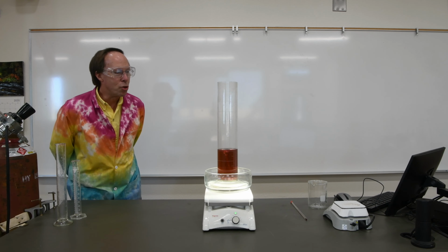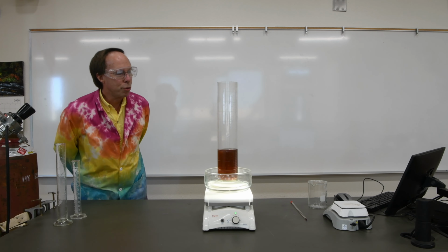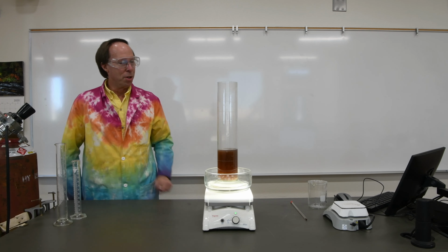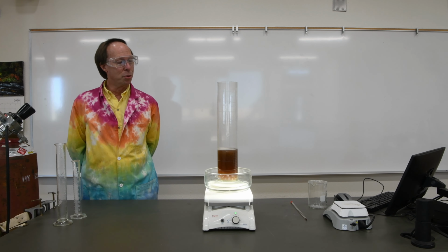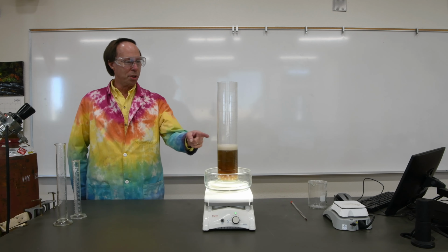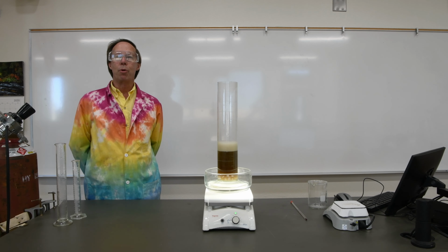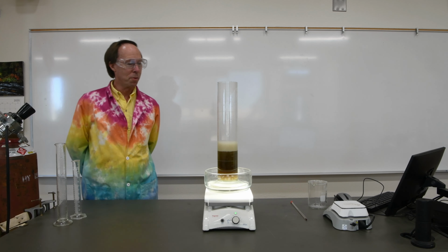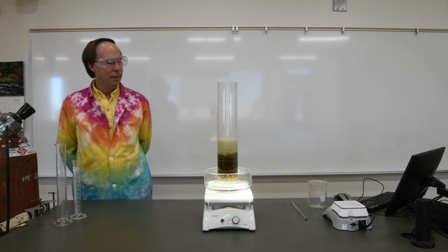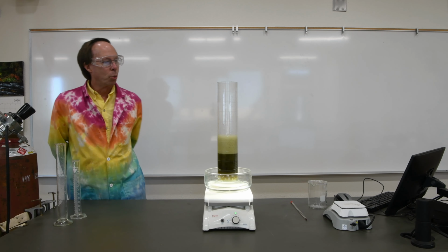It's already beginning to change color, telling us chemical reactions beginning to occur. And we're also seeing a lot of bubbles forming. I've got this overflow dish here just in case the bubbling gets a bit too violent. It's now become sort of an amber color. The reaction is really going to town now. As you can see, lots of bubbles forming. Those bubbles, of course, are carbon dioxide, which is one of the products we normally get in combustion, that along with water. Eventually, the cobalt catalyst becomes sort of a lovely green color.